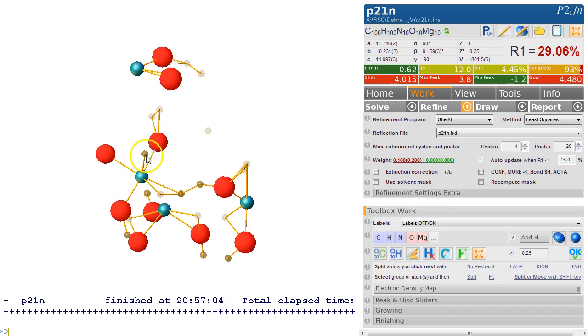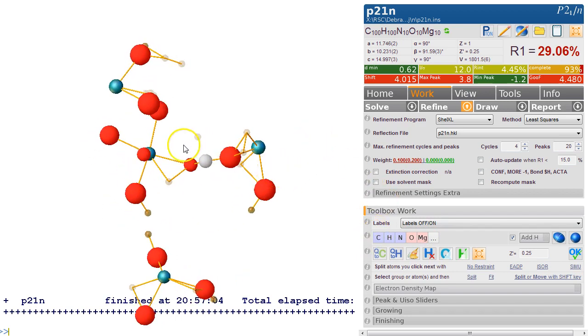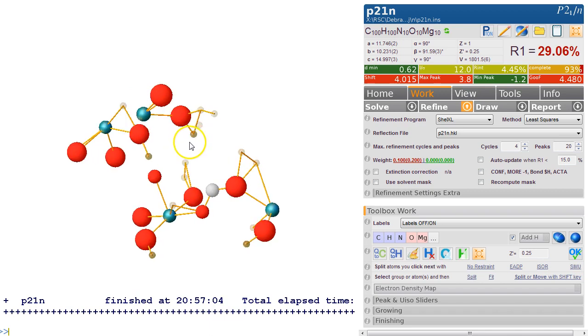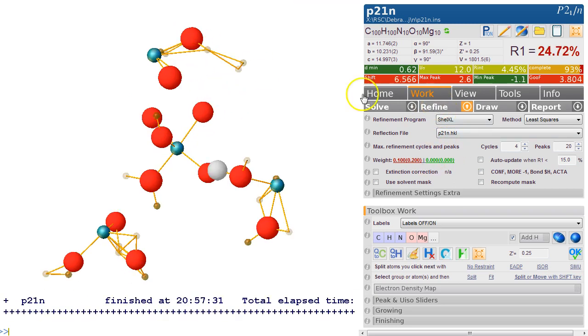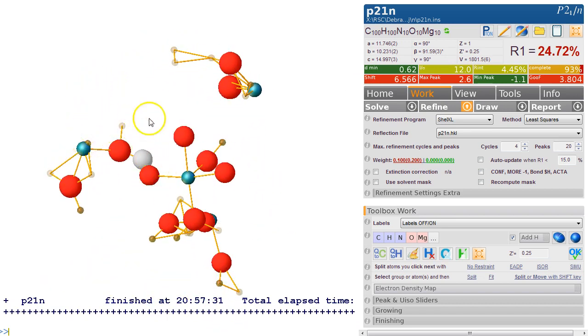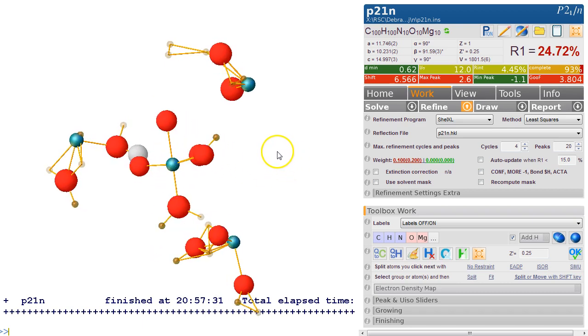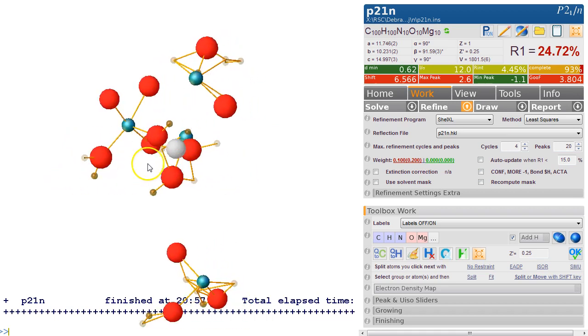So that looks interesting. So we're going in here, we're making these ones more oxygens. This one's probably a carbon if that's the case. So we have a carboxylate, a formate possibly. But what is very strange here is that these magnesium are quite small and these oxygens are quite large. So let's see what's going on here. So we look at that. So something is wrong here. So that really does look like a formate, and this is a metal with 5 or possibly 6 atoms around it. So that looks quite plausible.